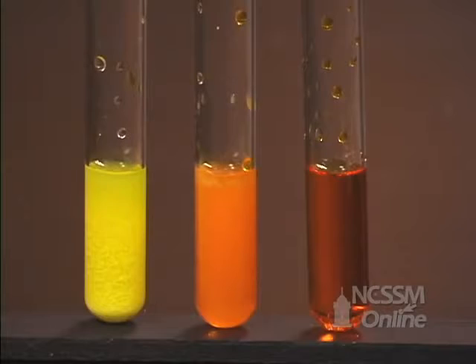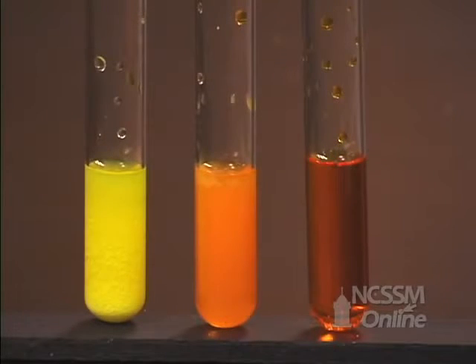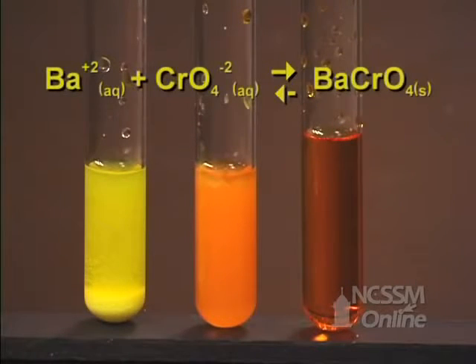To the third tube, we're going to add some nitric acid to the tube first, and then we're going to add barium chloride to the solution. In the first tube, there's a high concentration of chromate ion, so we get a large amount of precipitate. In the second tube, we only get a small amount of precipitate.